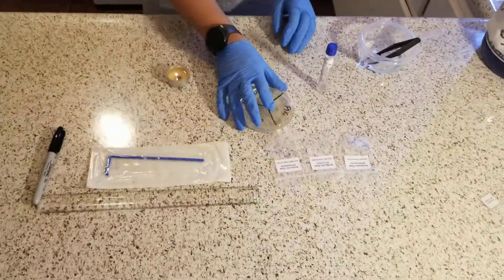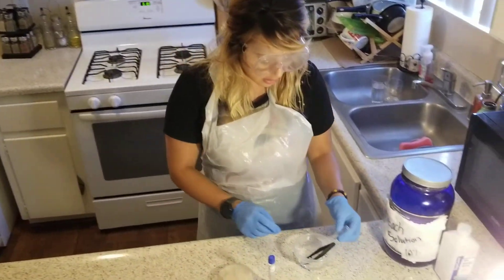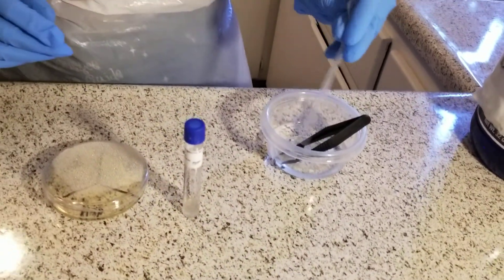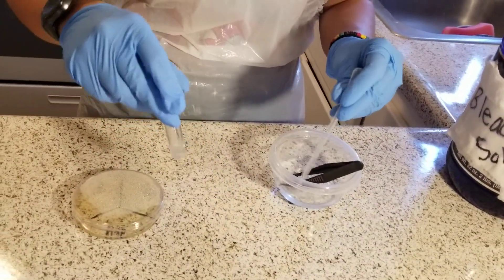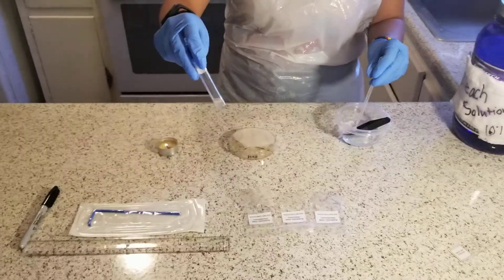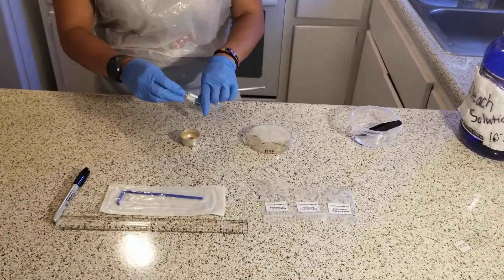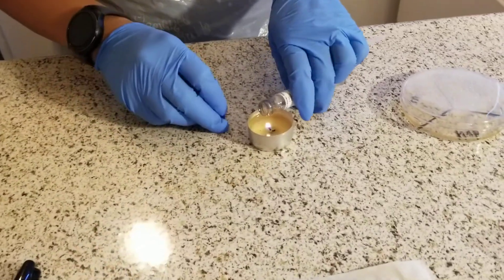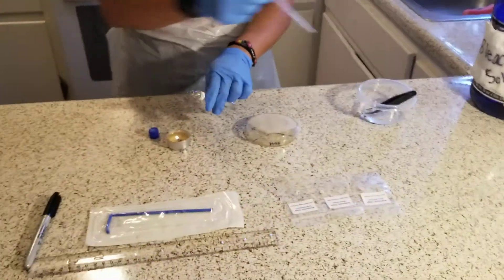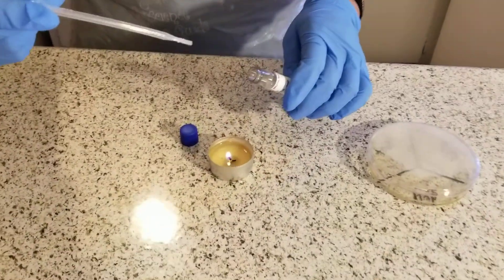First, I'm going to flip the plate over and have it open. Then I'm going to take my pipette — it's been sitting in alcohol — and make sure it's dry. Then I'll be collecting from the active culture broth of Staphylococcus epidermidis. First, I'm going to sterilize the lid by passing it over a candle flame. Then I'll collect 0.5 ml with the pipette.